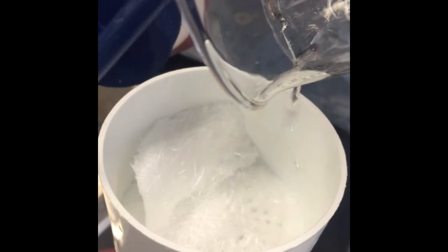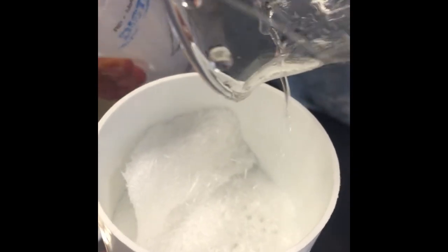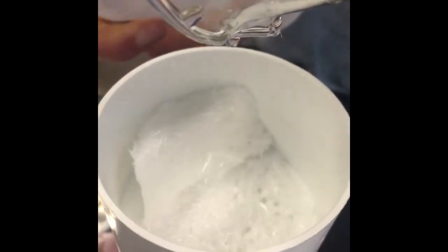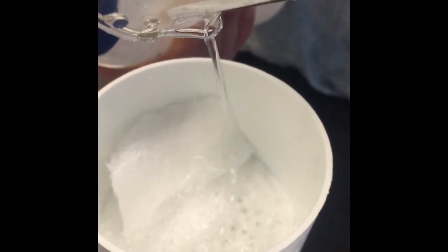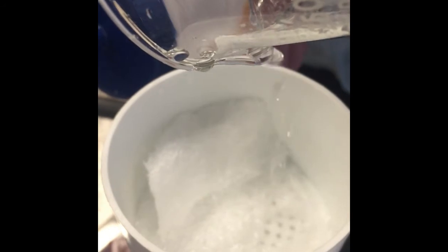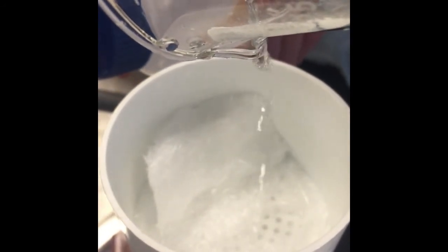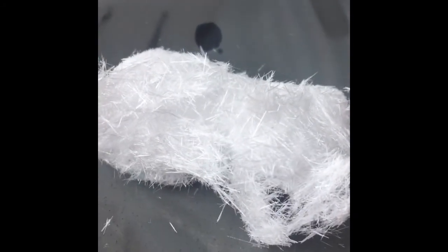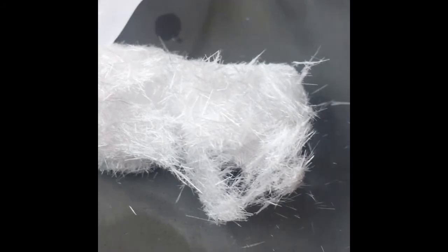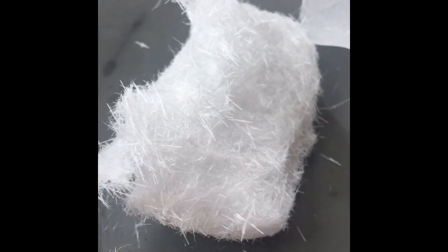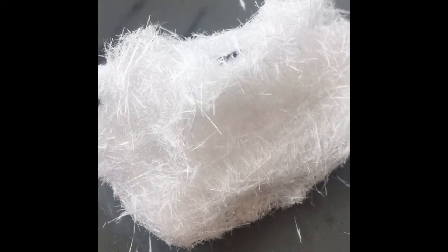And because this isn't very soluble in cold water, we can wash lots of it. And now we have our nice crystals of salicylic acid. And we shall dry these and then take a melting point and find the percent yield.